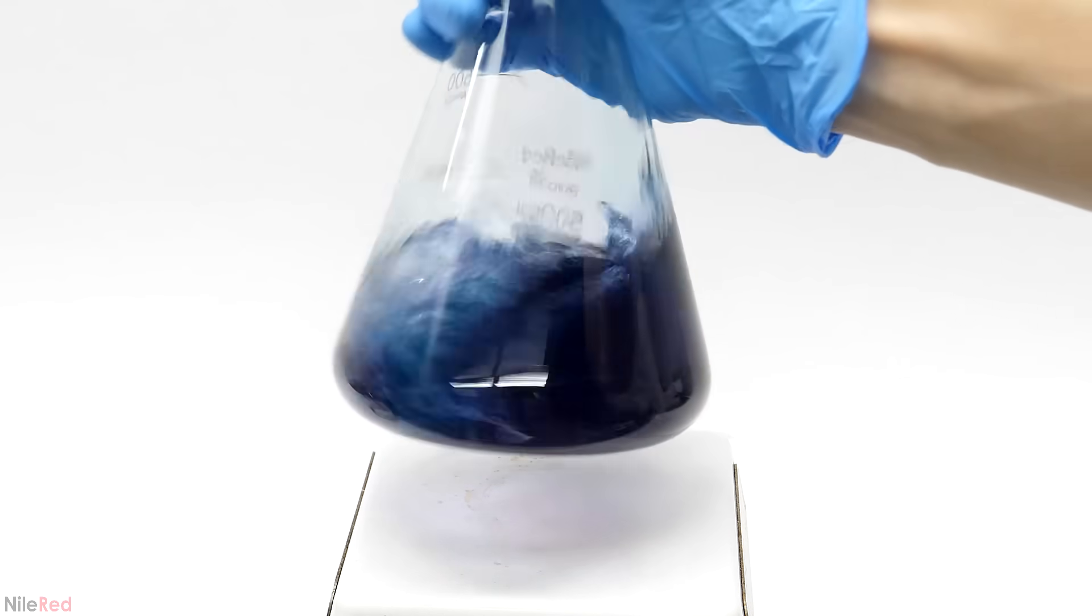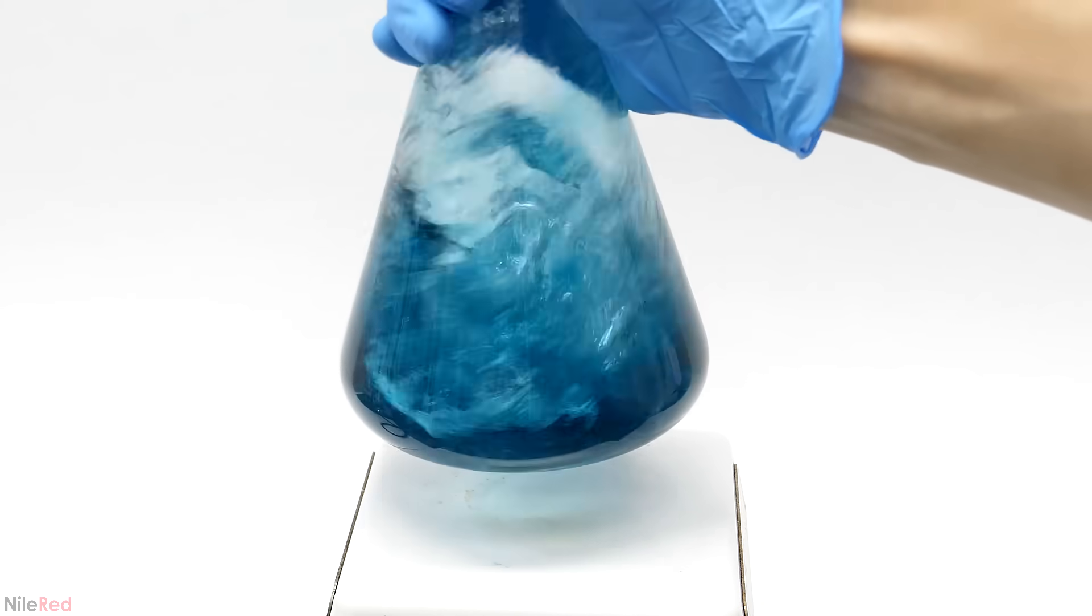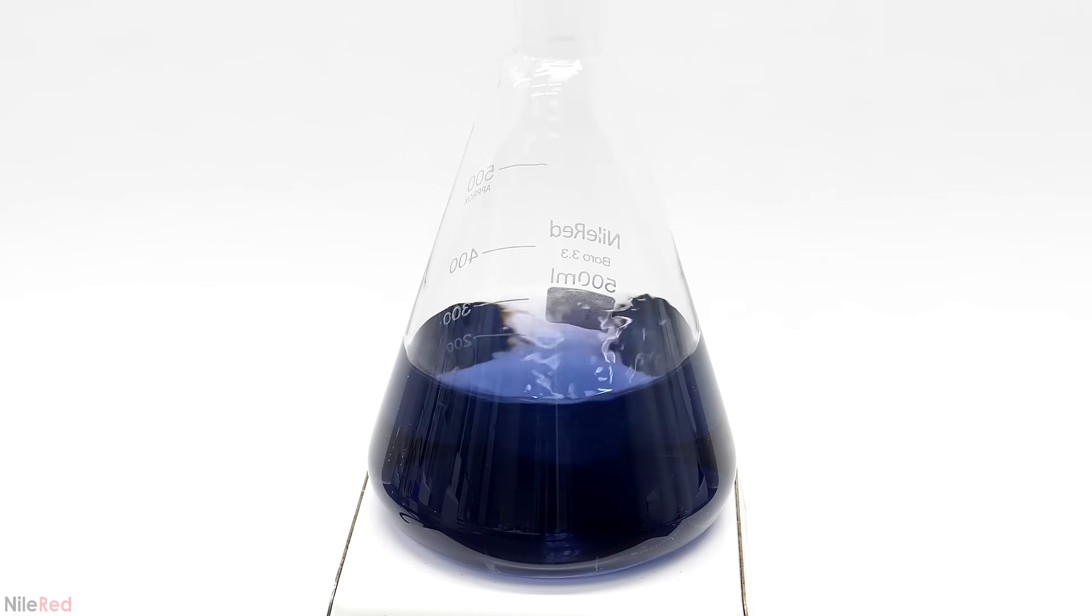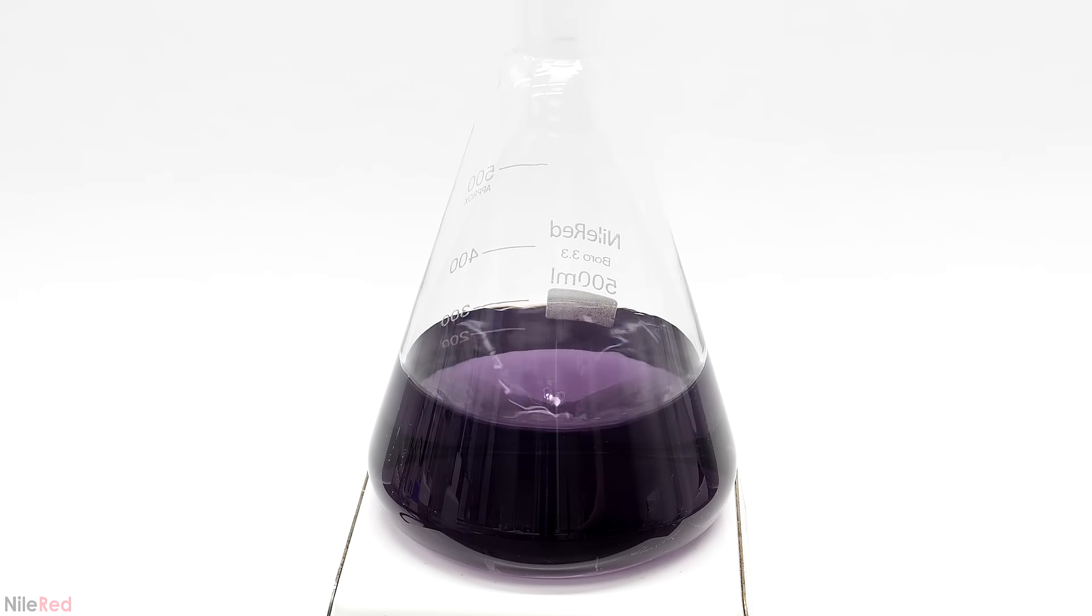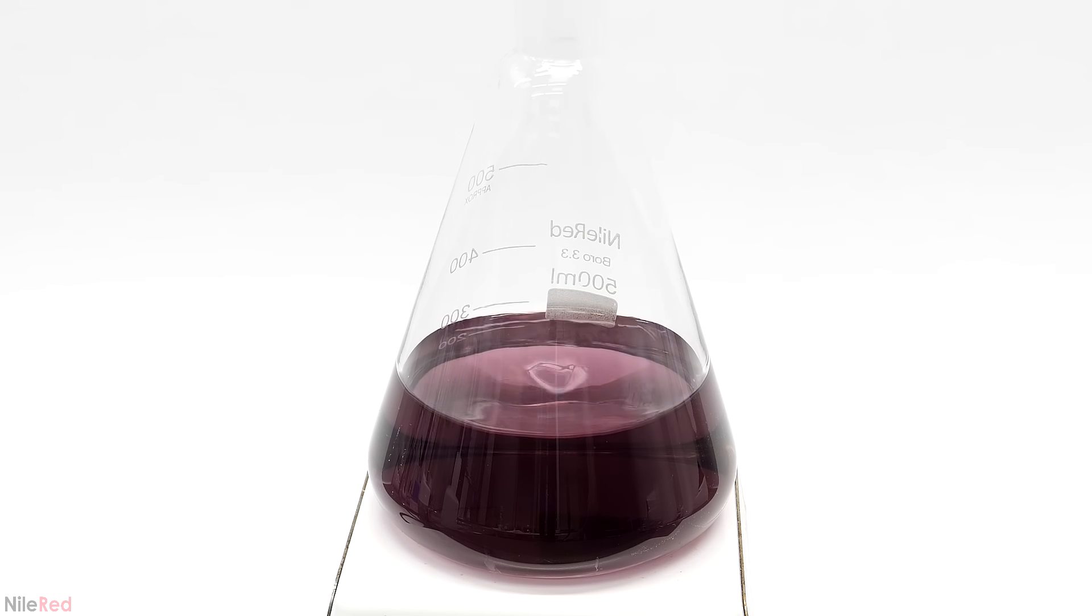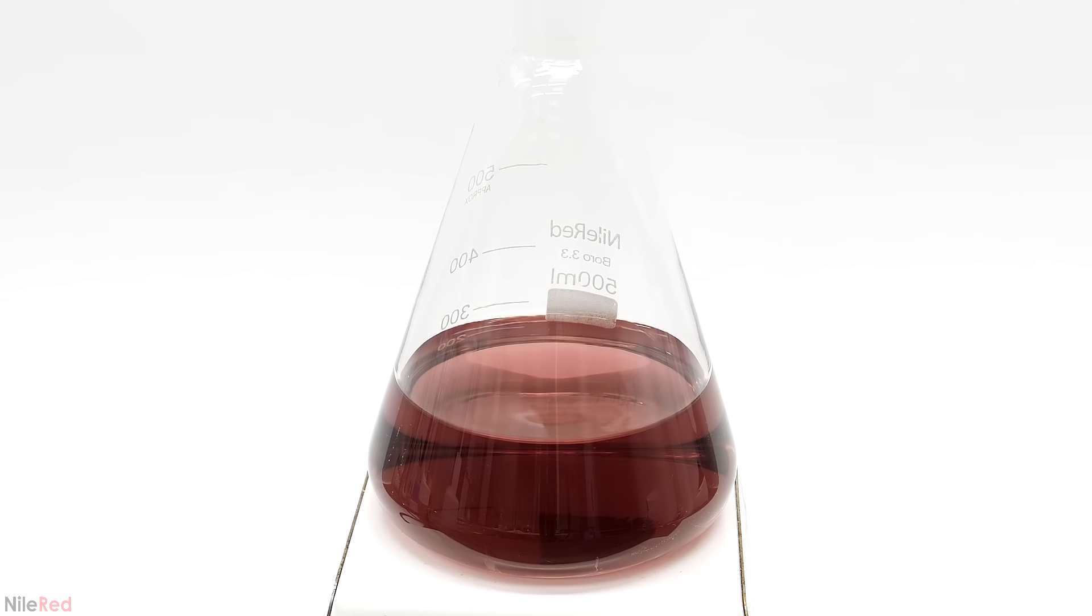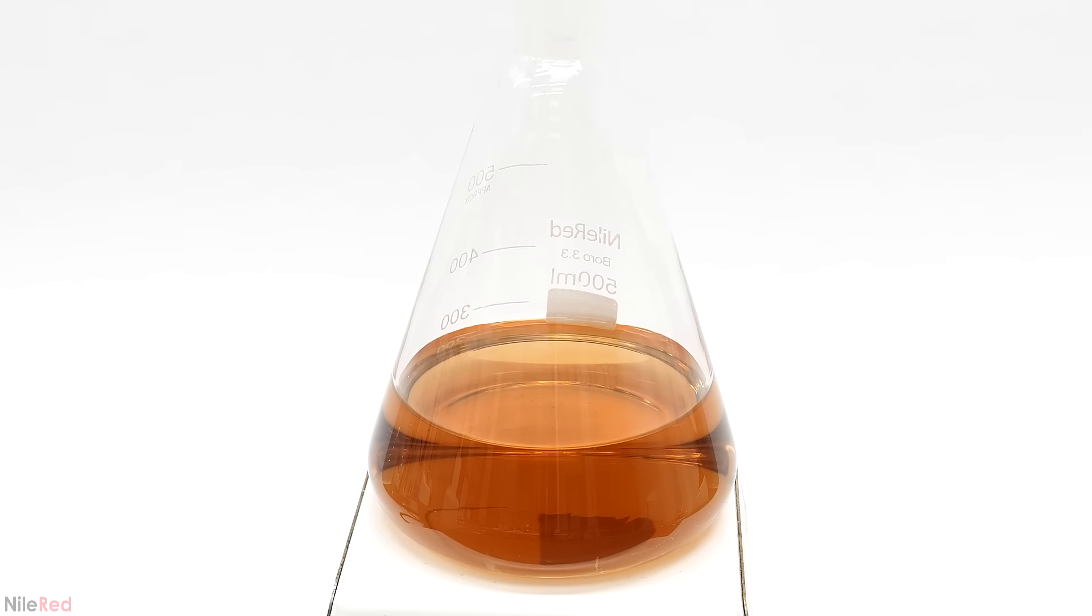In any case the color change here was quite interesting and very different than what we saw before. It seemed to go through a much larger range of color and the color changes also weren't as distinct. It was a much more gradual shift and I think I actually like this version more than the original one.